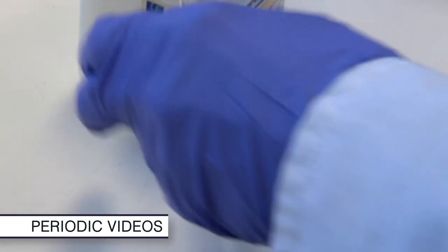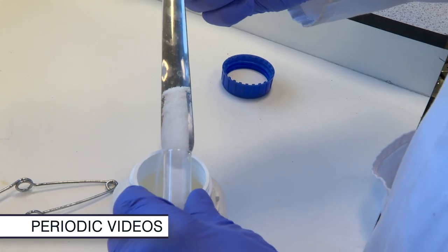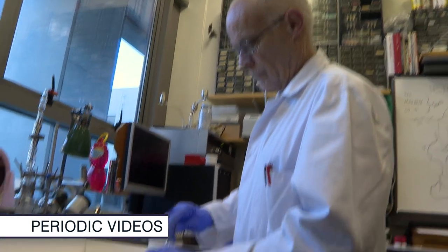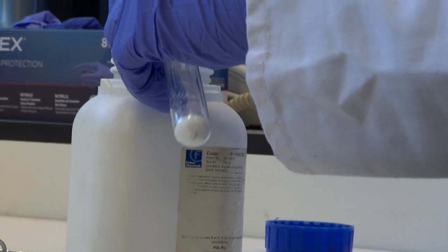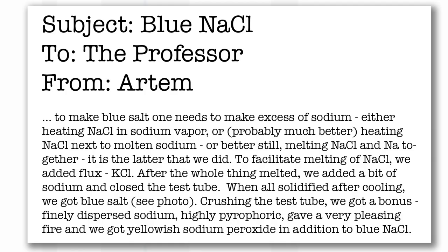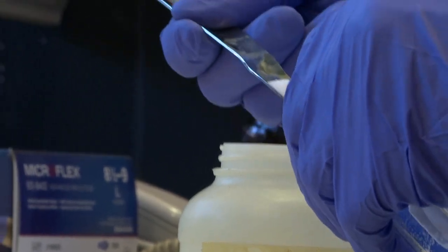Neil and I were quite excited because I got an email from my acquaintance Artem, saying that it was possible to make sodium chloride blue. I mean a blue color, not some sort of classification. His recipe was slightly vague: mix sodium chloride and potassium chloride and heat it until it melts.